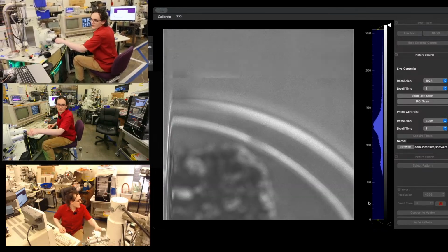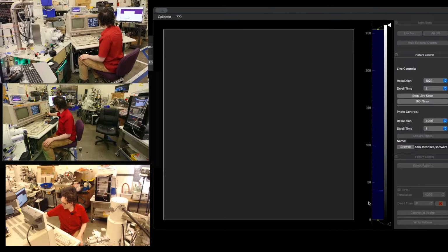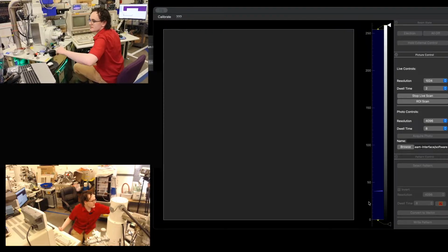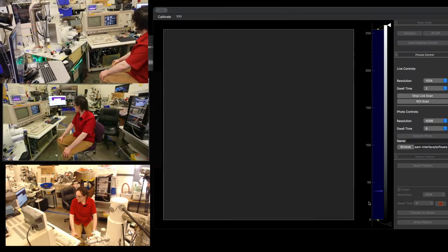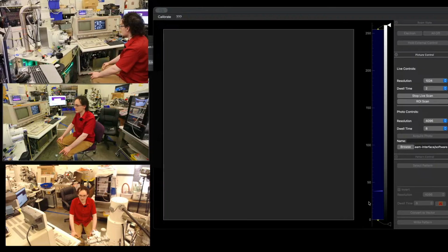Well, I haven't fully saturated the filament yet, but we can see ours. Oh, that was not happy. What did you do? Huh, interesting. V7 cycled twice now. Why is it acting so weird? V7 cycles when the pressure is not met.